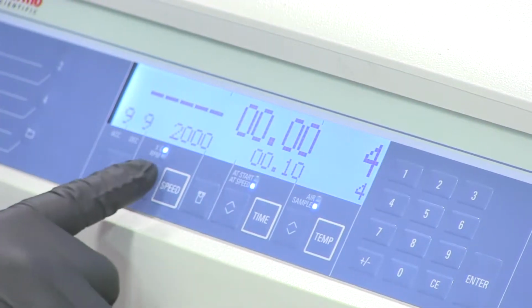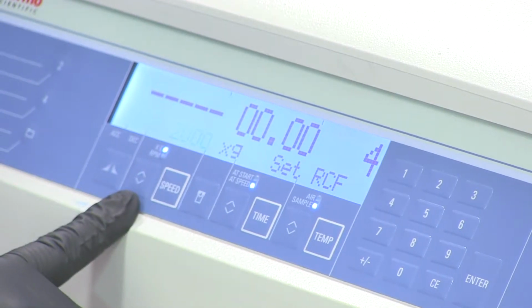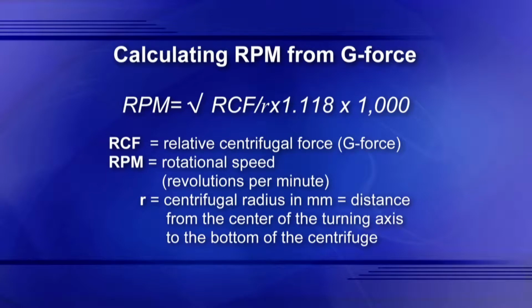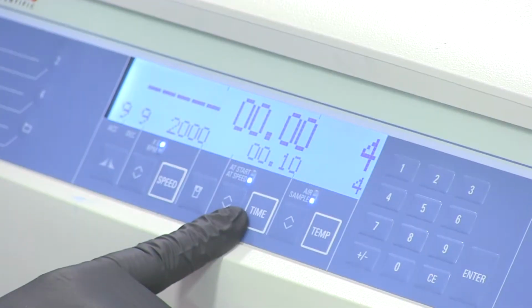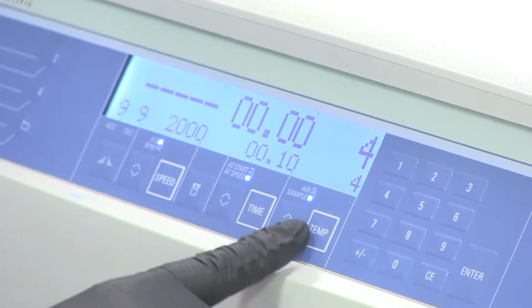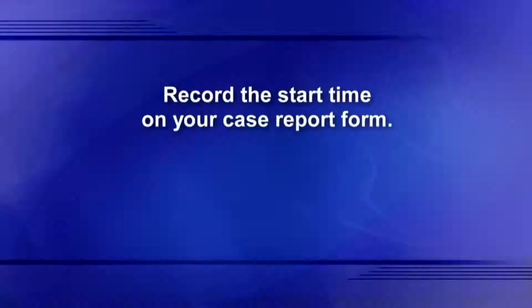Set your centrifuge at 2000 Gs, converting to RPMs as necessary. Set your time for 10 minutes and your temperature for 4 degrees. And press the start button. Record the start time on your case report form.